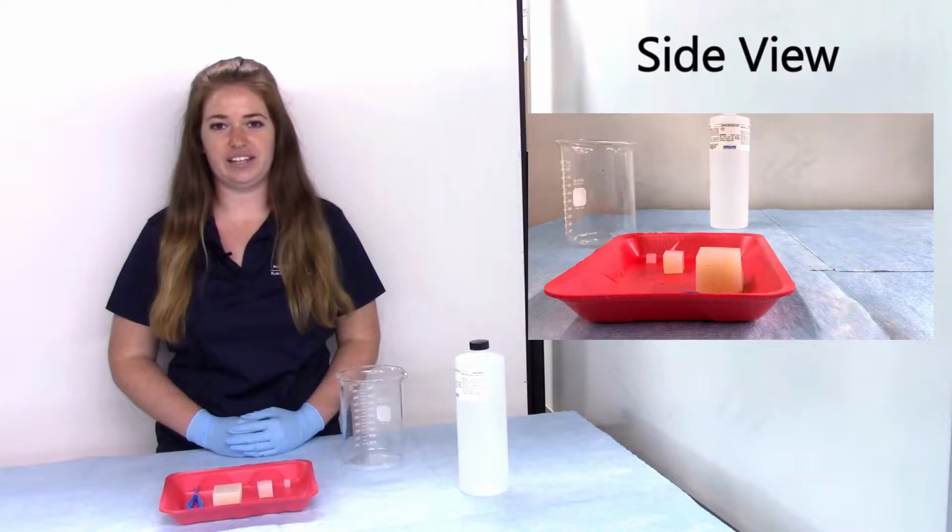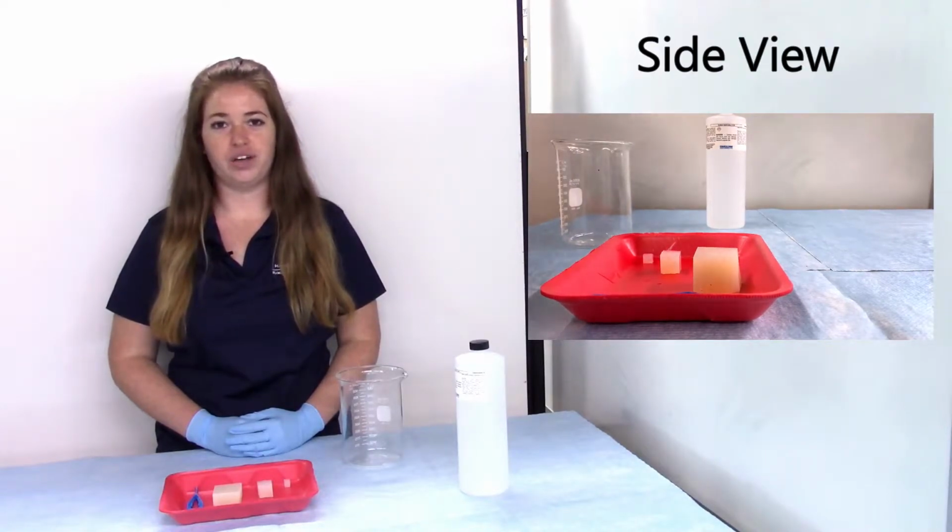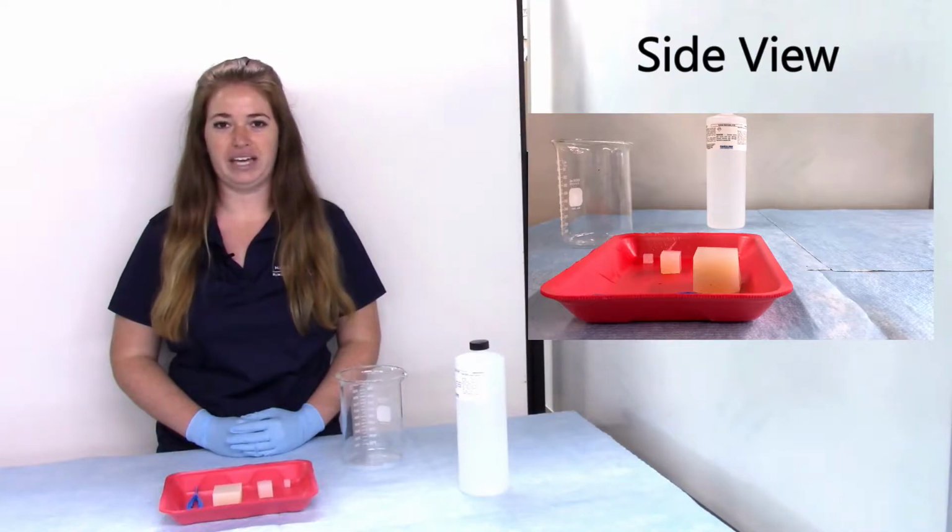Agar is a jelly-like substance made from an algae. These agar cubes also contain phenolphthalein. Phenolphthalein is an acid-base indicator. What that means is that in an acidic or neutral environment, phenolphthalein will remain colorless. However, when phenolphthalein is exposed to a basic environment, it will turn pink.